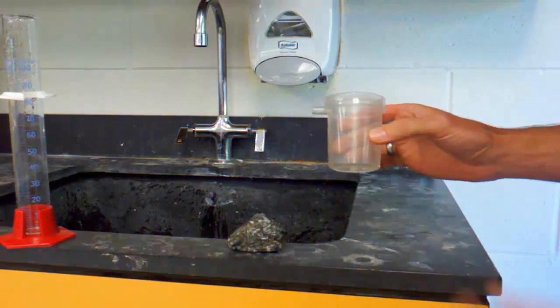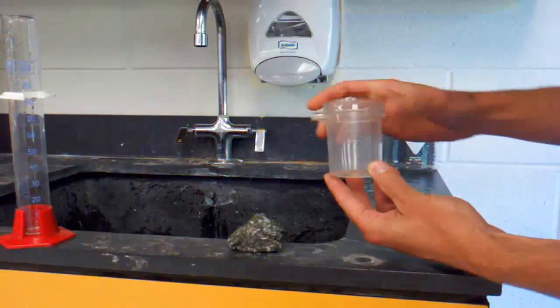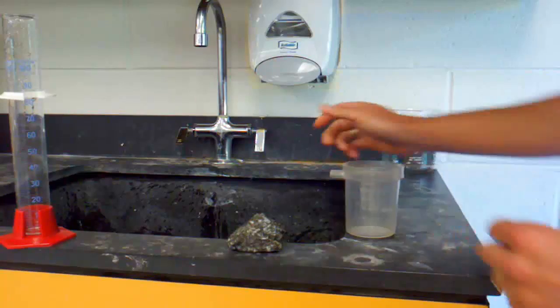I'll use an overflow beaker or overflow cup. Notice this spout on the side. This allows excess water to run out the side.